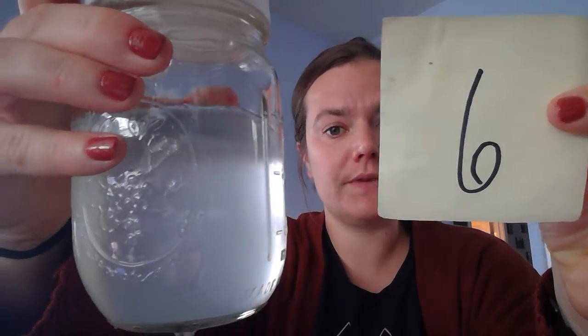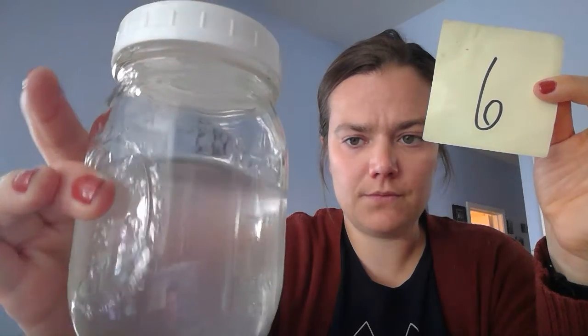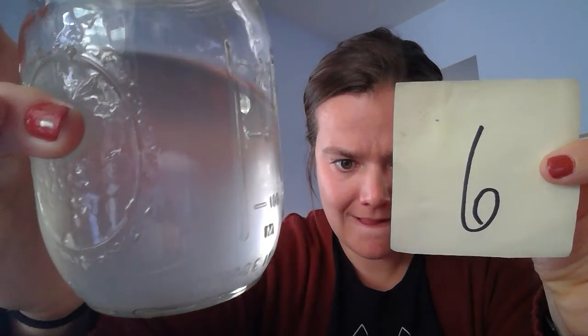Smelling this one, it has a sweet smell. It has kind of a clean smell. But I don't know. And then our final sample here. Using that turbidity vocab word, it is not perfectly clear, but it's not nearly as bad as the one before us. There's some bubbles maybe that have formed at the top, but not a lot. There do appear to be some chunks inside. You can see those kind of floating around.